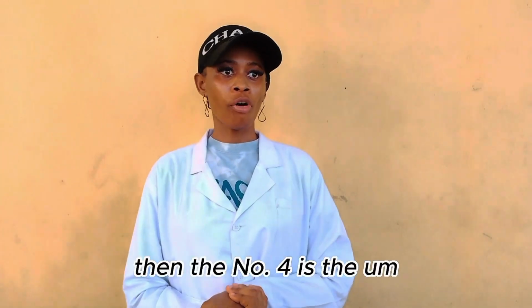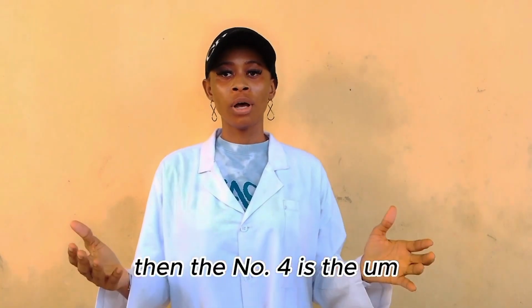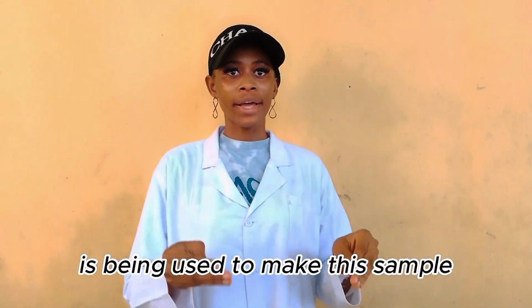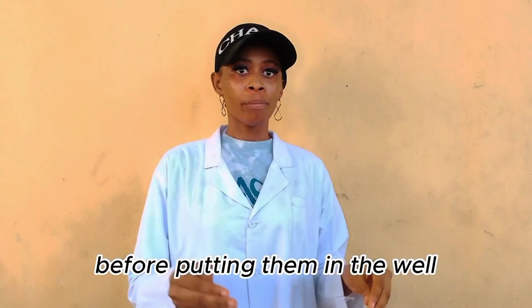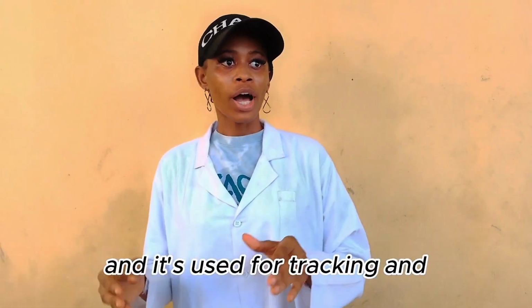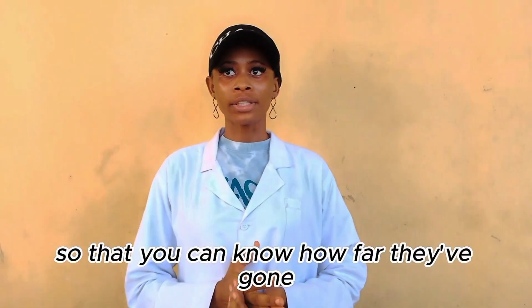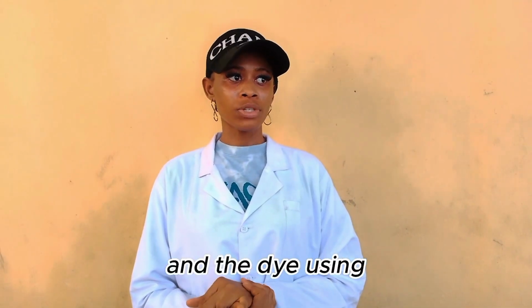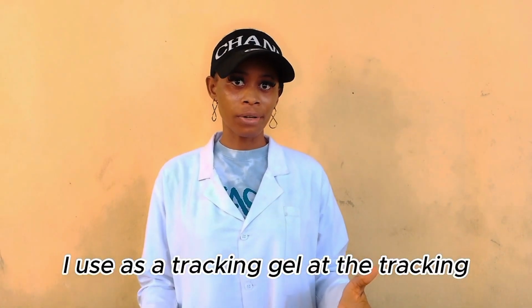Then number 4 is the sample loading dye. The sample loading dye is used to prepare the sample before putting it in the well, and it's used for tracking and monitoring the movement of these proteins so that you can know how far they've gone. The tracking dye used is the bromophenol blue.